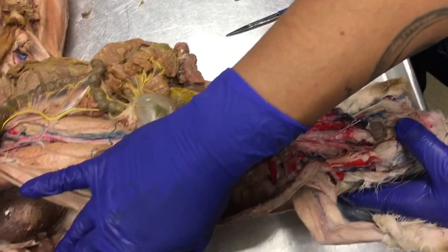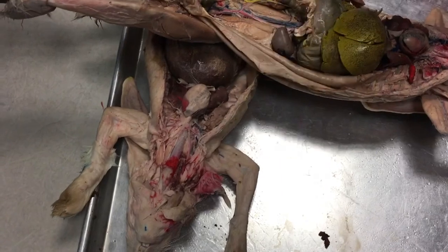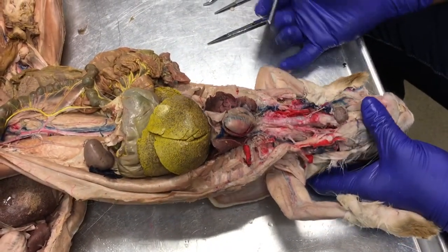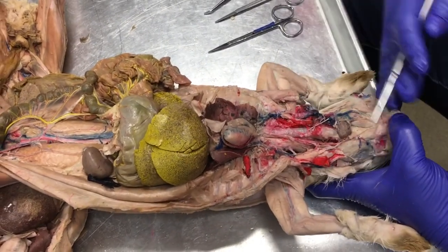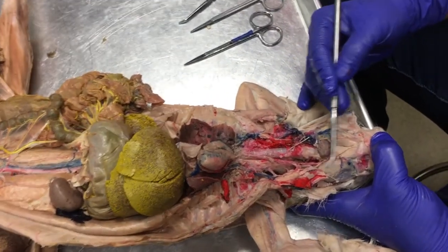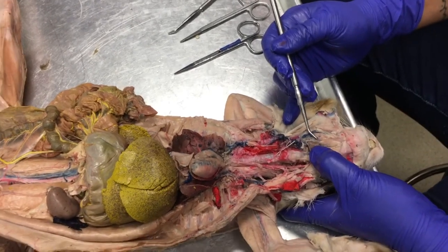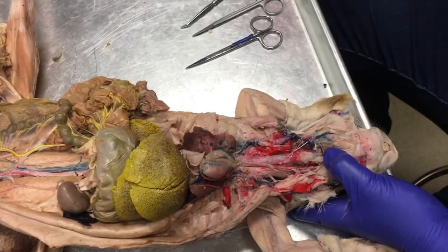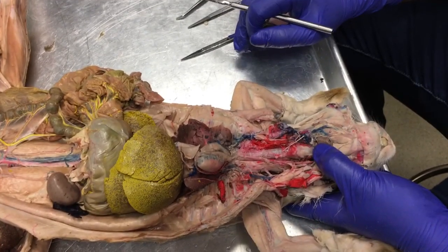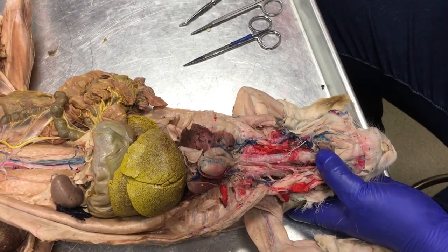Now, this poor kitty bunny doesn't have very well injected anterior veins, and mine are kind of explodey, but they're visible enough. Okay, so what you're going to look for when we're draining the blood from the head is that magic masseter muscle. And you're going to look for where those sublingual glands that we dug out were. So remember, the anterior of the masseter muscle, along the, what's that called? The muscle, mylohyoid.